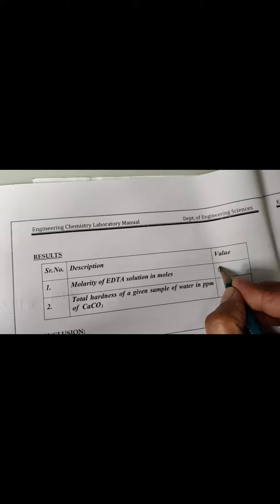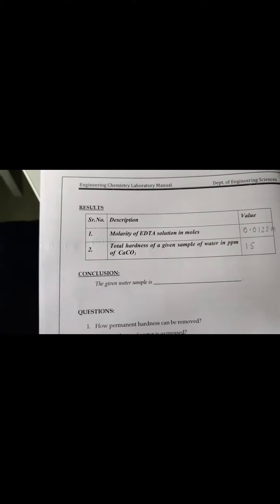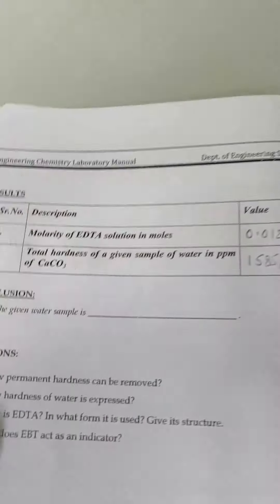Finally, the result: the given water sample has a molarity of EDTA solution of 0.0122 moles per litre, and the total hardness of the water sample is 1585 ppm. The conclusion is that the given water sample is very hard. This is all for this practical — thank you all.